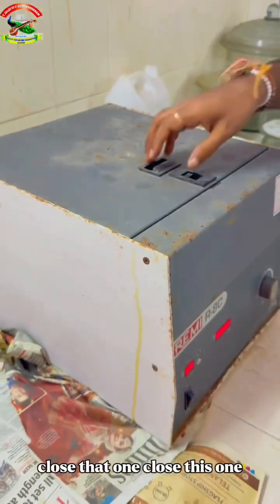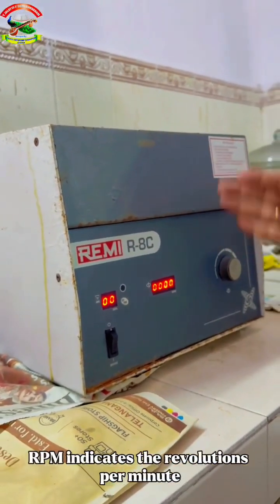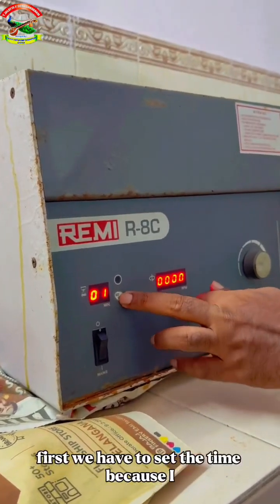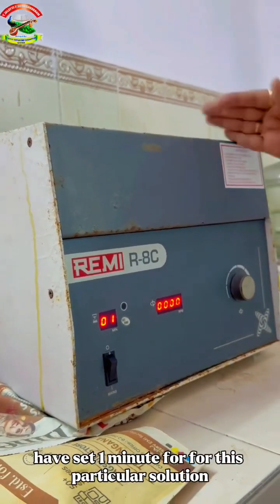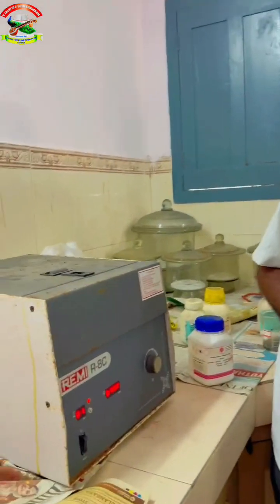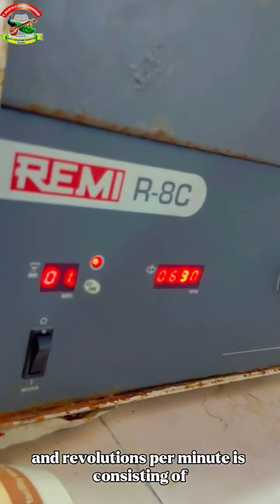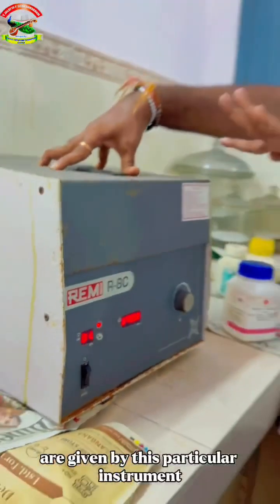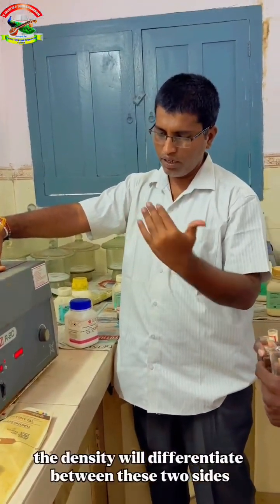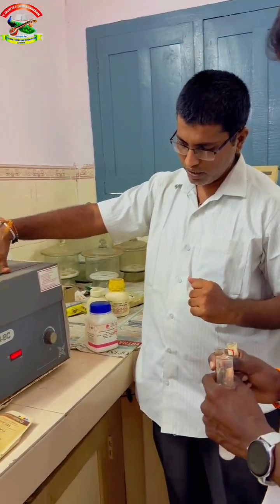Close that one, close this one, and at first we have to set the time and also the RPM. RPM indicates the revolutions per minute, which we have to set. First we set the time, because I have set 1 minute for this particular solution, and the RPM will be set automatically. Revolutions per minute is how many rotations are given by this instrument in 1 minute, and based on this rotation, the density will differentiate between these two salts, and they will get separated based on the density principle.